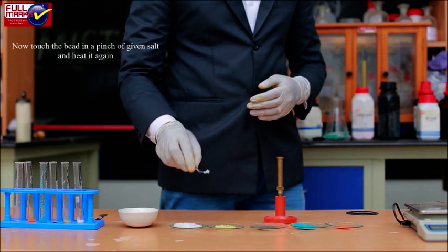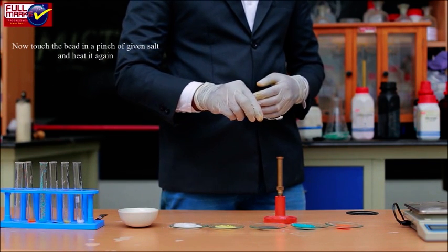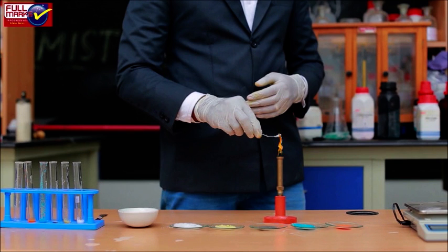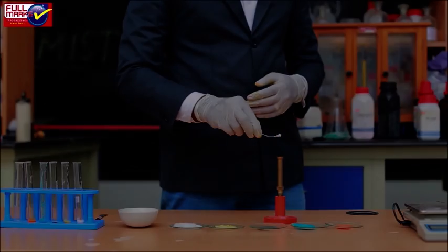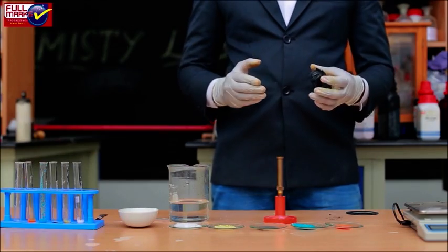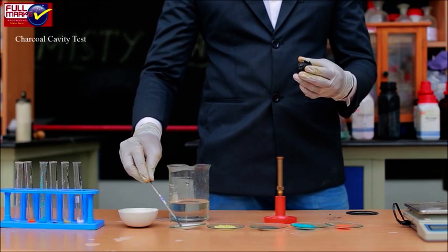Heat the bead again and observe the color. Heat the bead in oxidizing flame and reducing flame in turn. Observe the colors in oxidizing flame and in reducing flame.